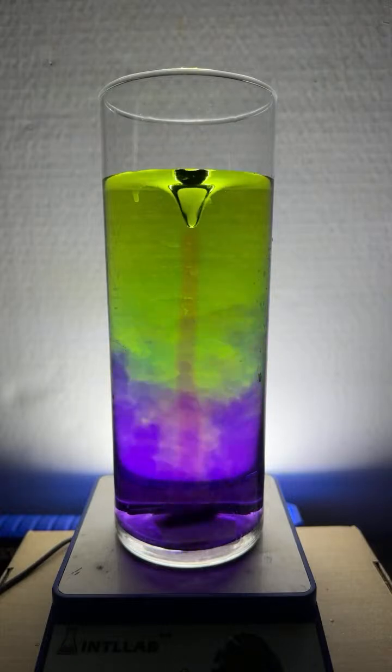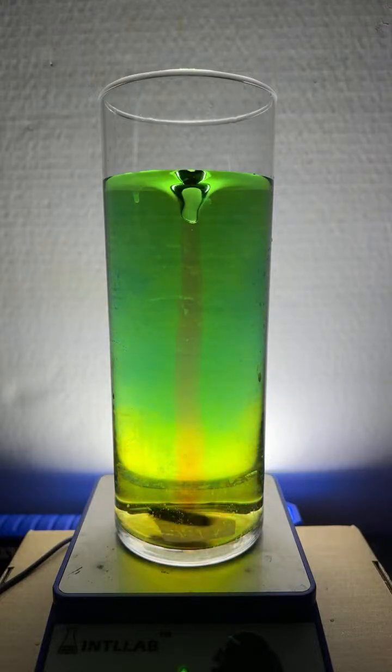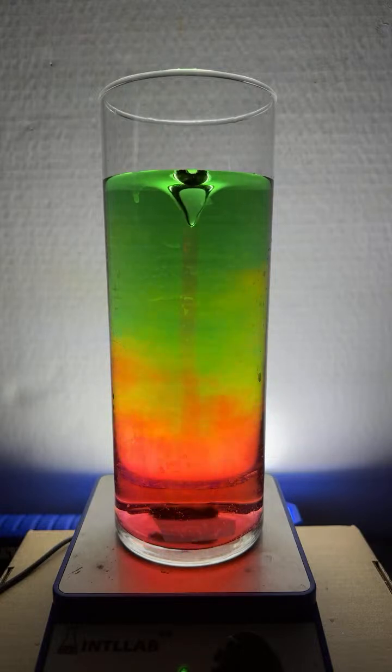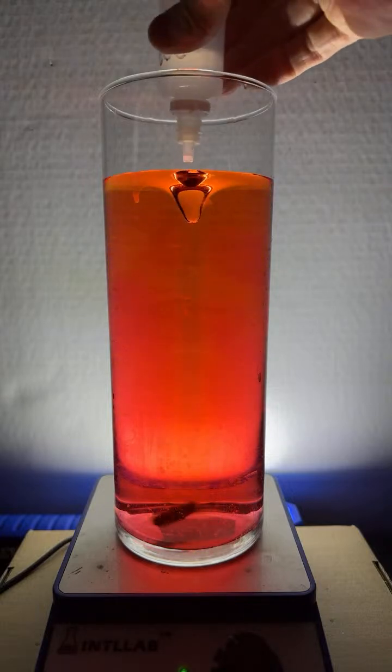A little more acid, I think. We got to get some more red in there. Get the red developing. When you see the green color, that means the acid and the base have neutralized each other. Right now, we got the stoplight effect going on. That's kind of interesting when that happens. Looks like we've got an excess of acid. That's why the red color is there. We'll add some base to pop it back in the other direction.